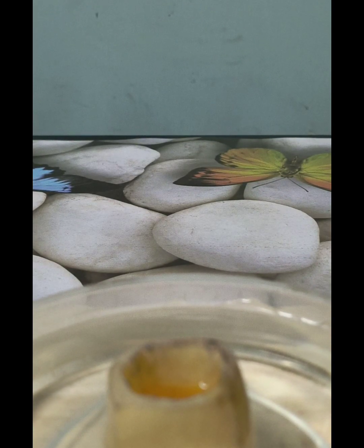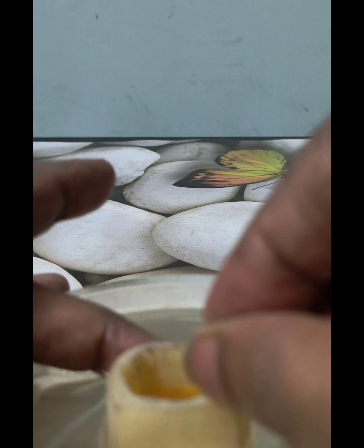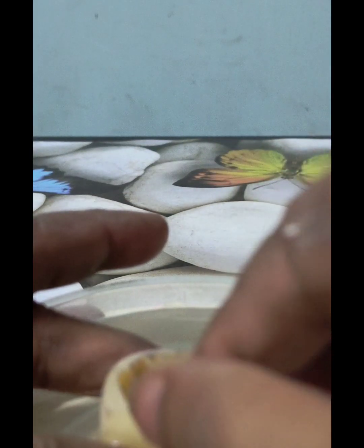And after the duration of the experiment, we will recheck the level of water in the potato cube. So let us mark it. Marking it from inside where the level of the solution is standing inside the potato cube. This is the line that is touching the level of the more concentrated solution inside the potato cube.